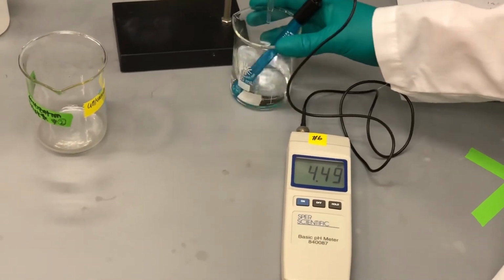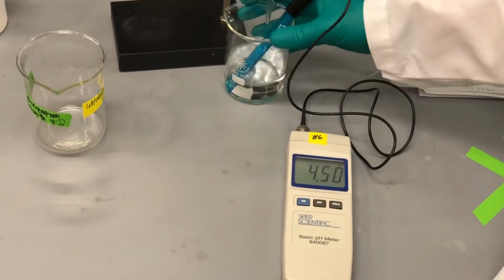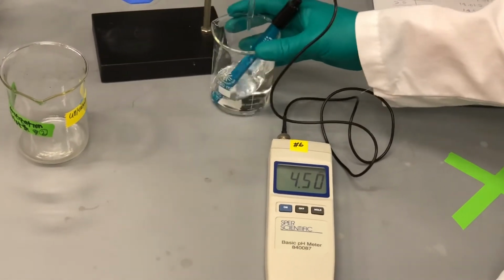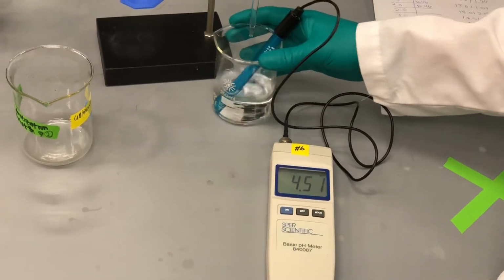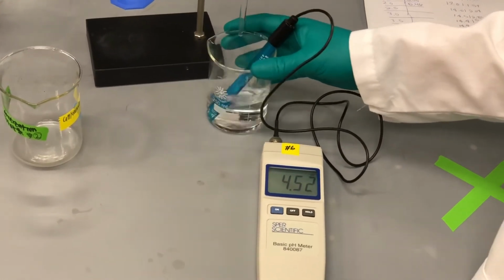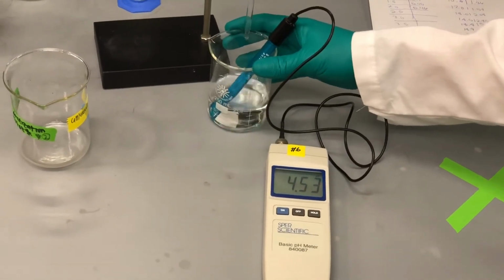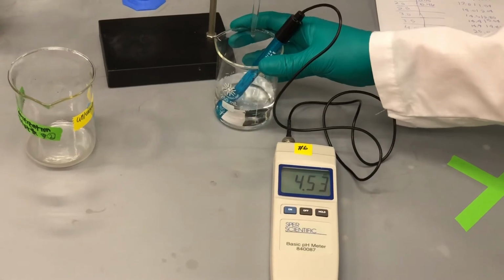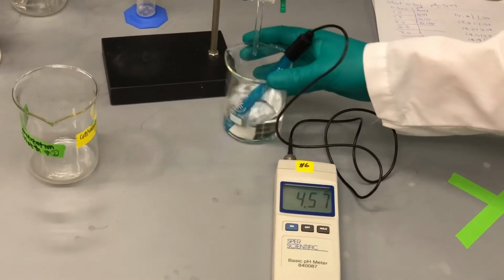Gosh, it's taking a while. I guess it's okay though. 19.5, 20.0. We're almost there.